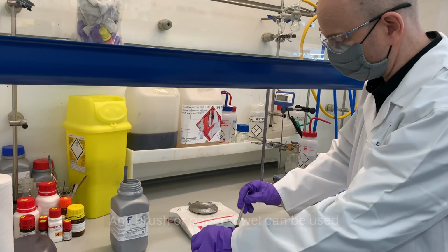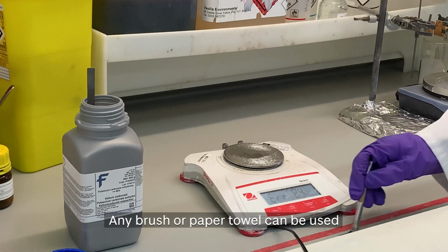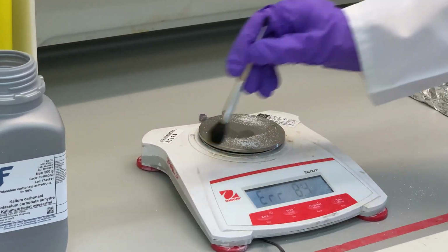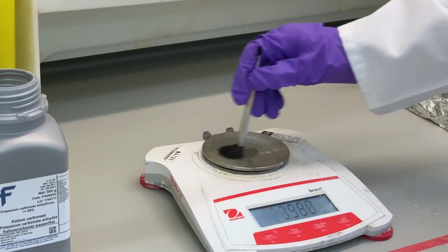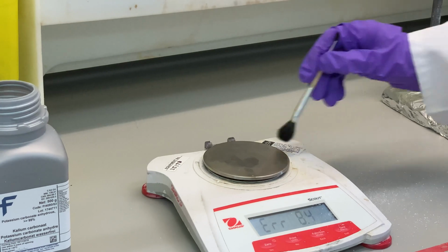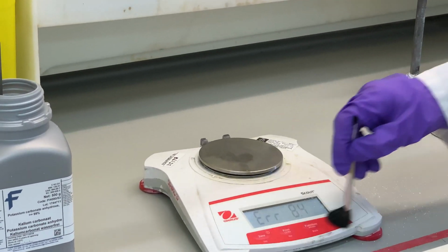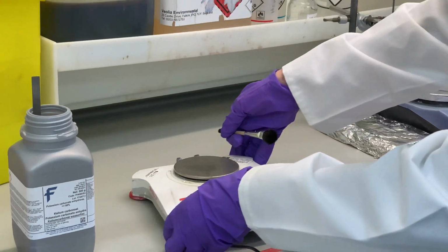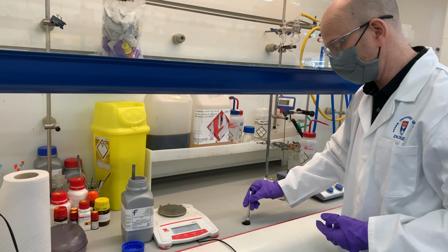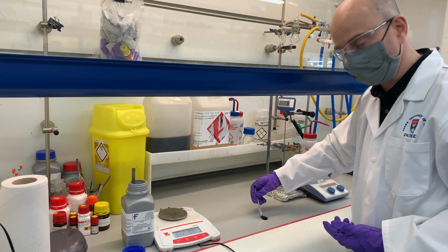So I'm just going to sweep up using one of these small brushes. You can use a dustpan and brush for a larger spill, or you can just use tissue paper if you don't have a brush available to you. You should try to make sure that you get as much of the spill as possible, because someone else who uses this equipment after you may not know that it's potassium carbonate. Then they may be concerned that it's sodium azide or potassium cyanide or something else that's quite poisonous.